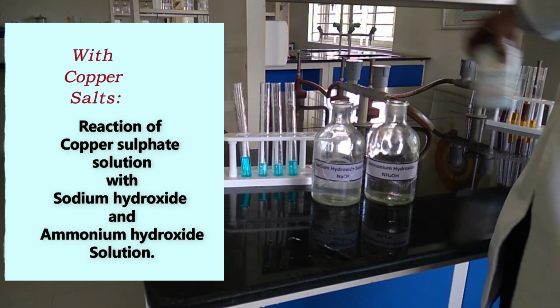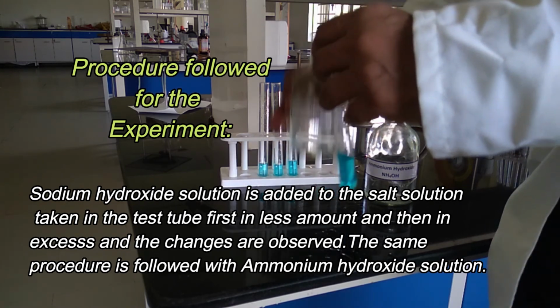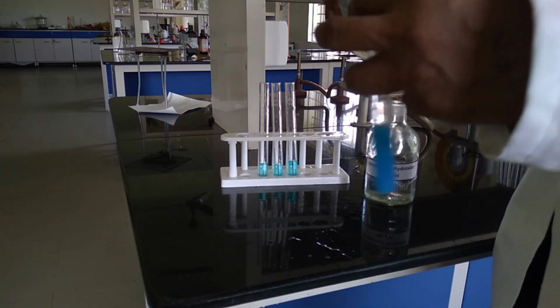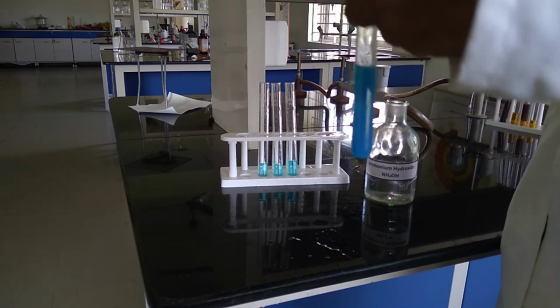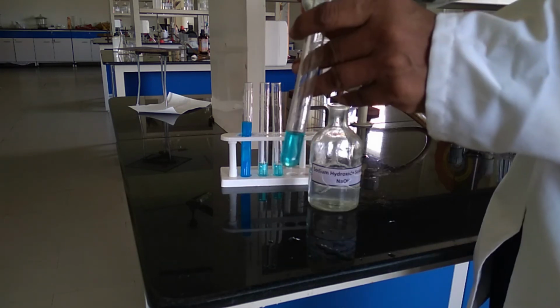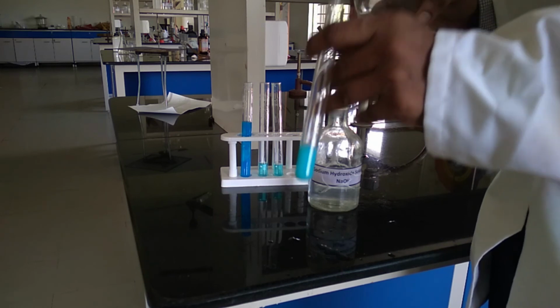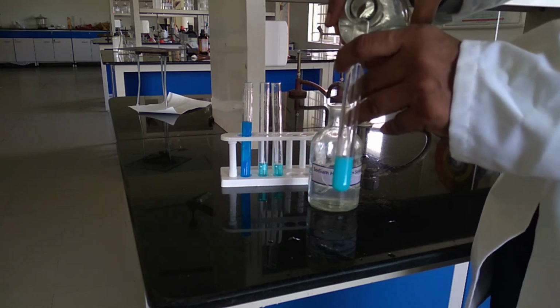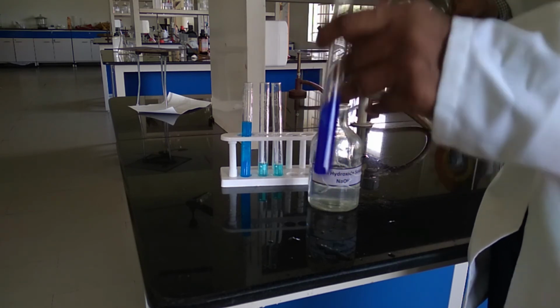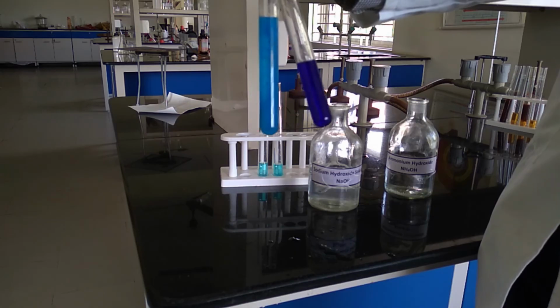I've taken copper sulfate solution in the test tubes. First we add sodium hydroxide solution in small amount. It is forming a sky blue color precipitate. And if we add in excess, there is no change. The precipitate remains as such. A small amount of ammonium hydroxide turns into a blue color precipitate, but if we add in excess, it turns into an azure blue colored solution. See the effect of sodium hydroxide and ammonium hydroxide on copper salts.